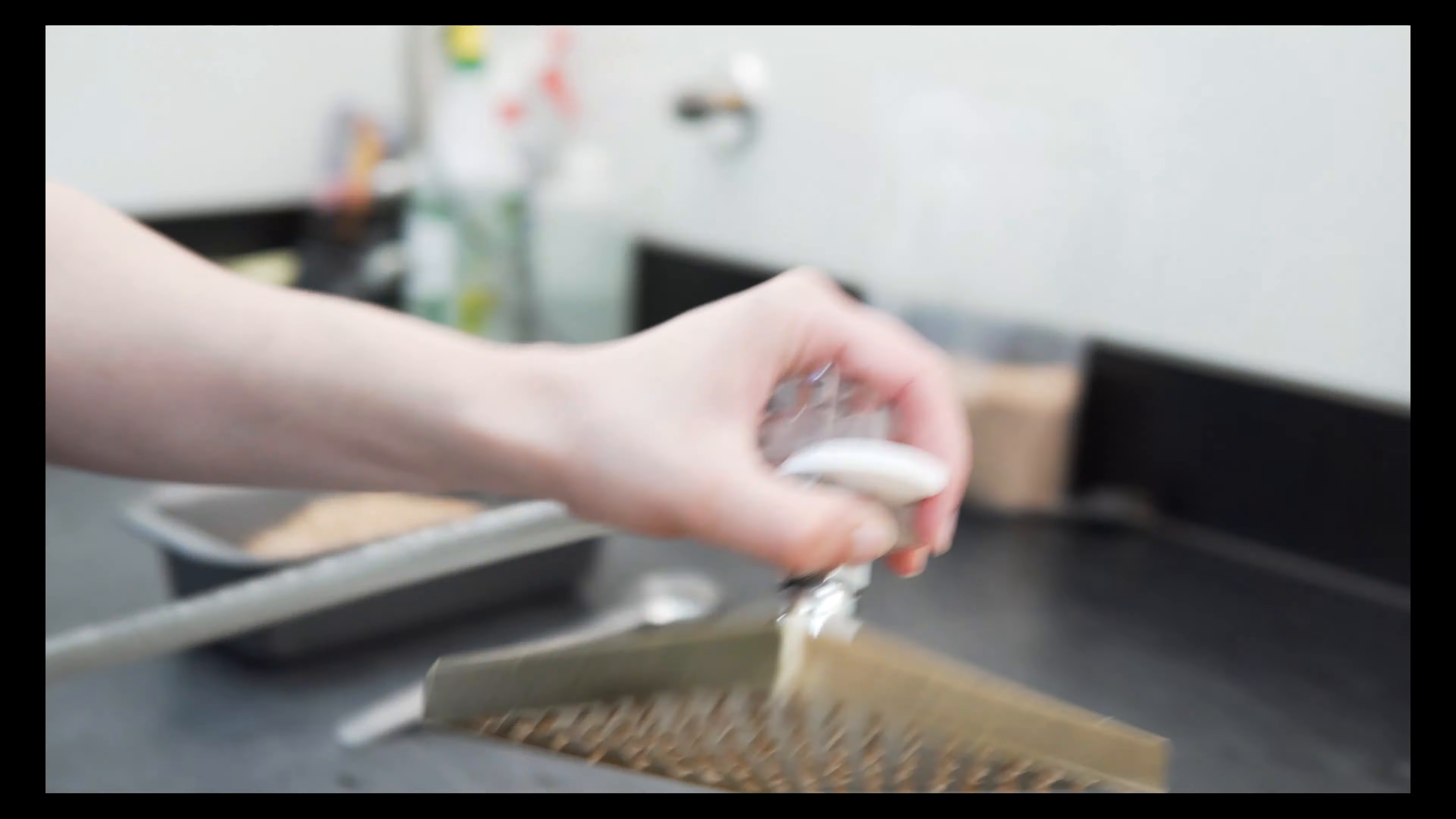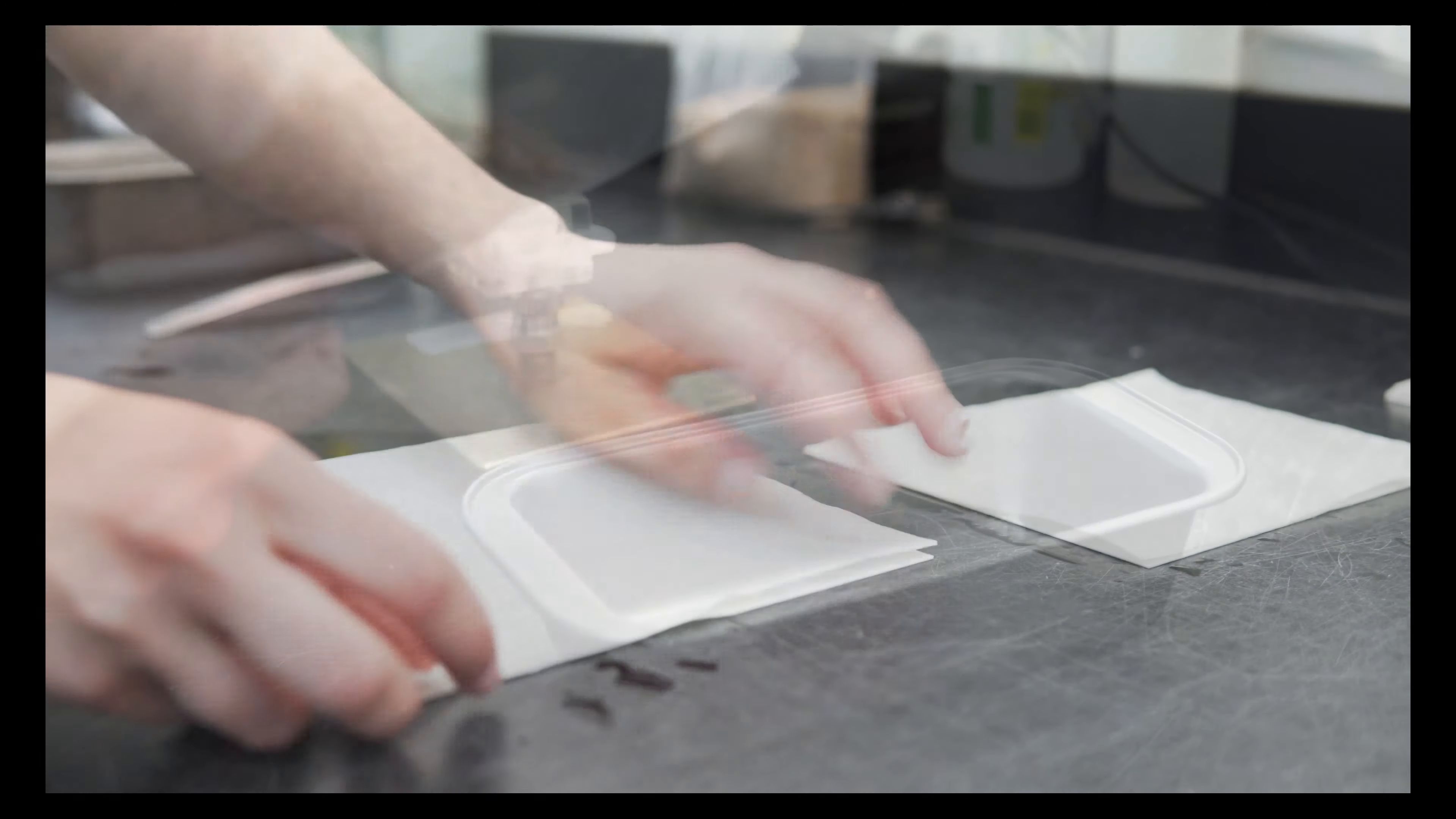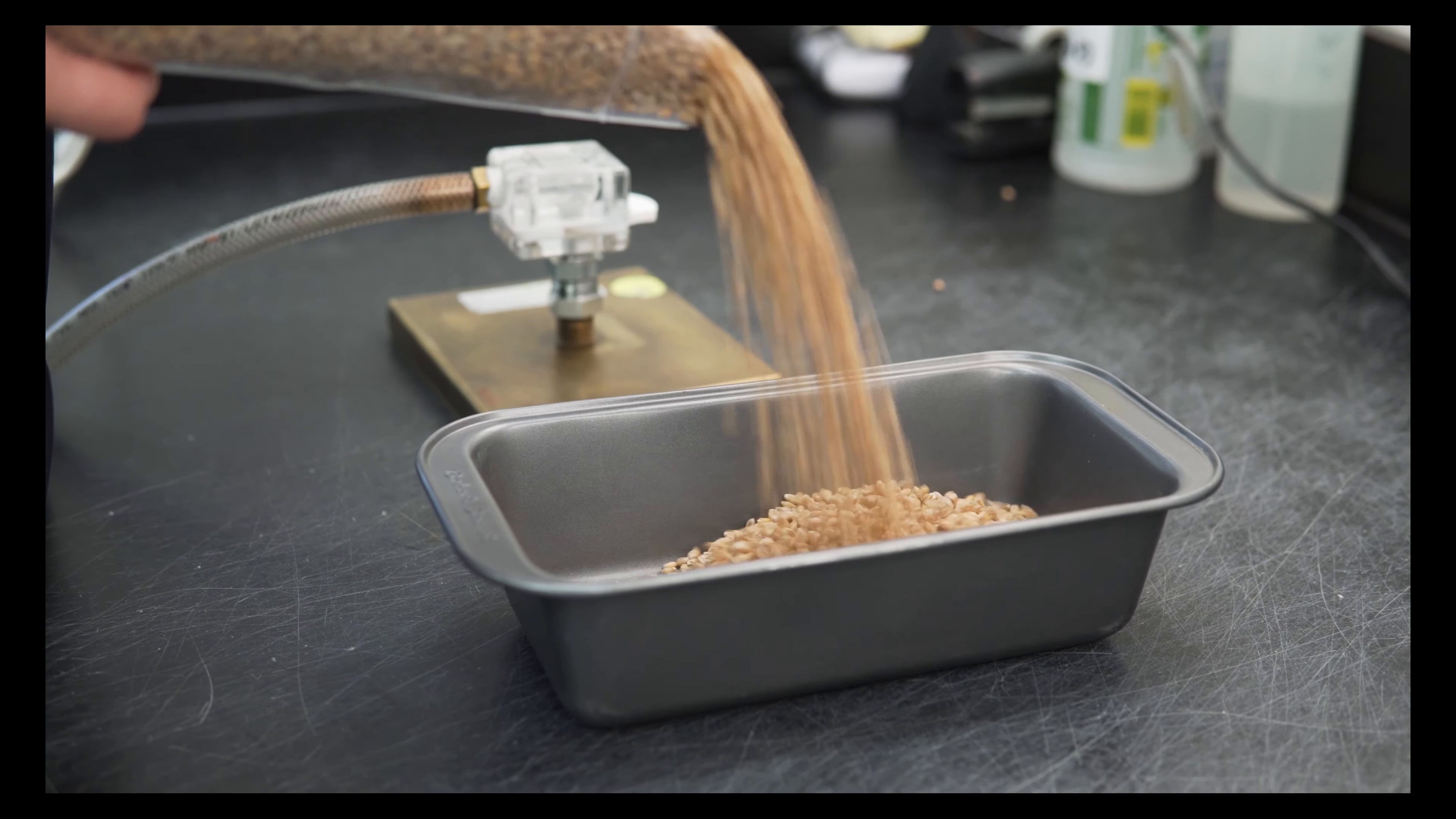In order to find out the planting value, our test involves thoroughly mixing and dividing down your seed for the working sample.